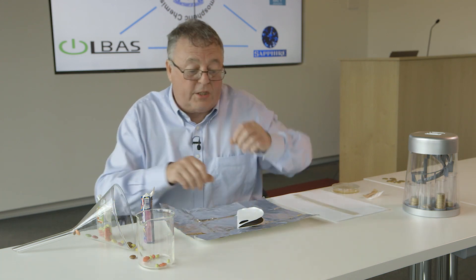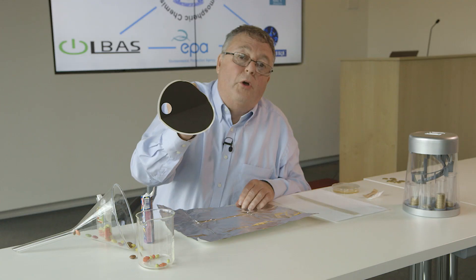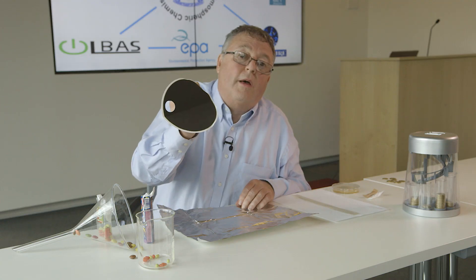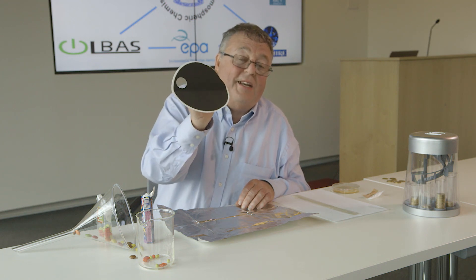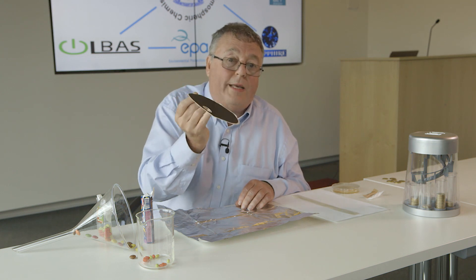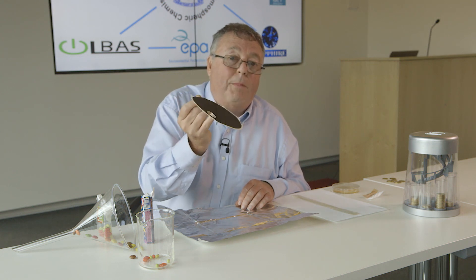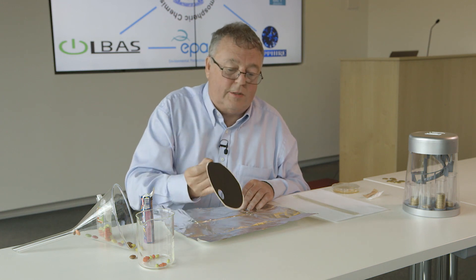A real sample is this filter paper — we used it for some burning coal in a stove, and this is the blackness that comes off. But the legislation is simply measuring the weight of the pollutants; there's no idea of what it is. If you think that's crude, you ain't seen nothing yet.